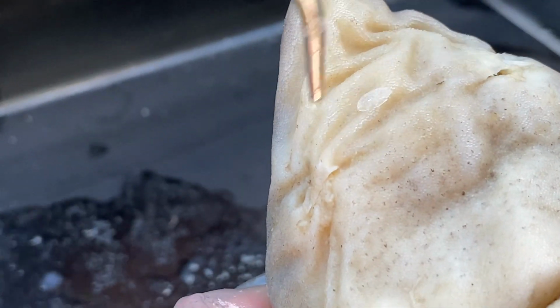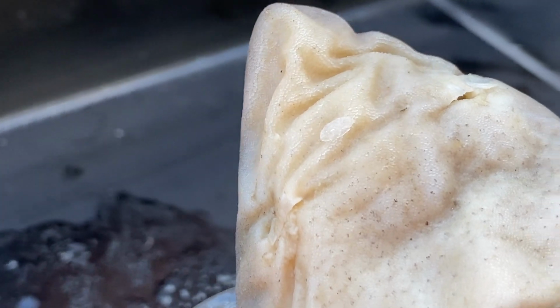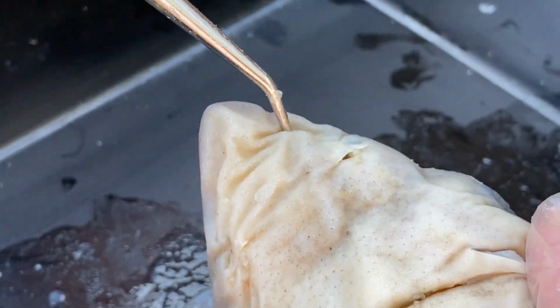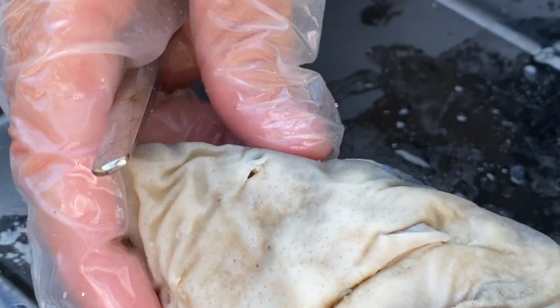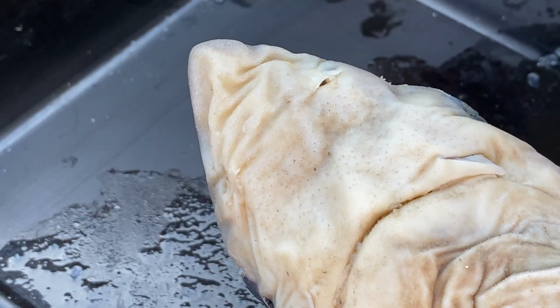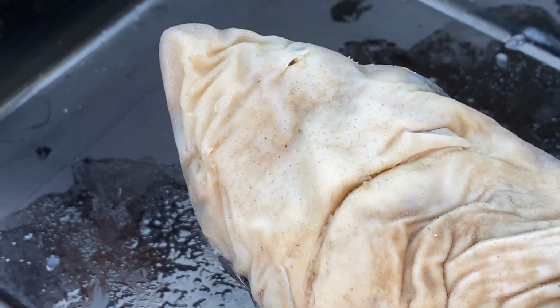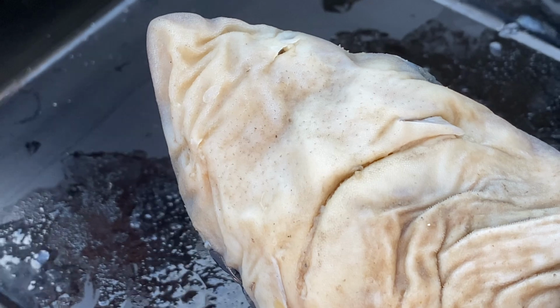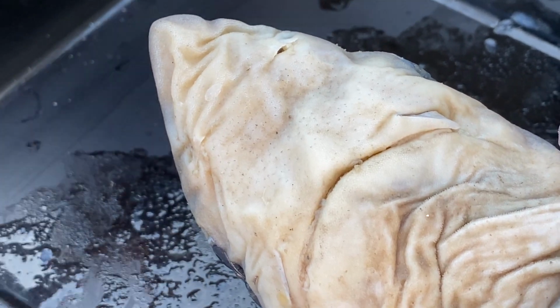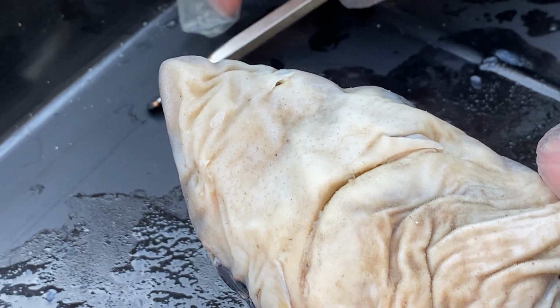The reason why they have two is the same reason why we have two. We can figure out which side of the body the smell is stronger. So when they are swimming, they are kind of doing like this through the water. By doing this, they're really smelling which side, the left or the right side of the body. They are smelling the urine or the blood or any other type of bodily fluids that's coming out in the ocean. So nares or nostrils are used for smelling.